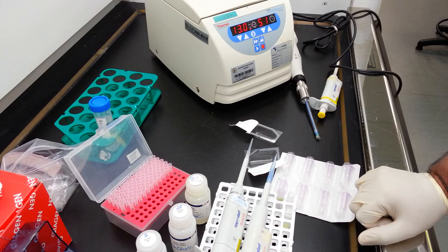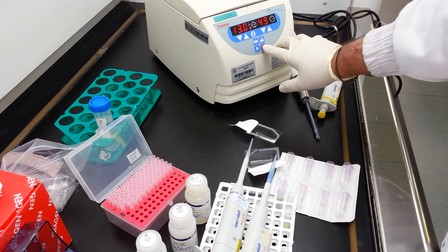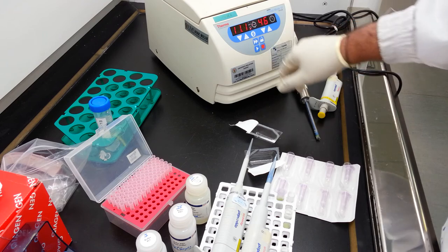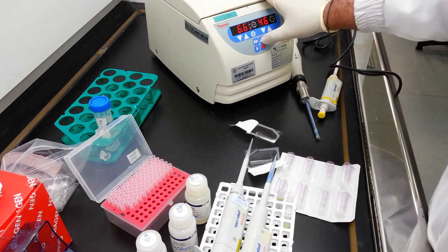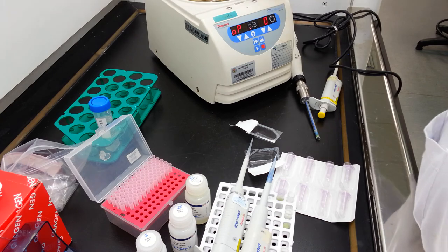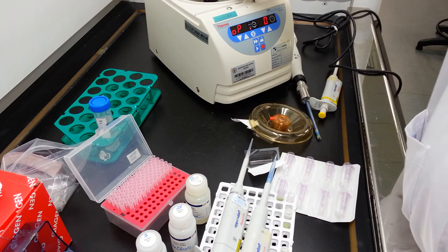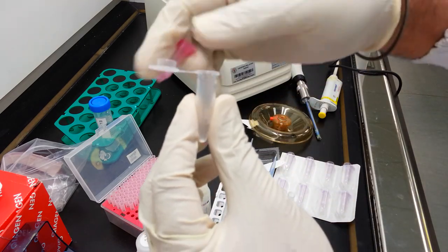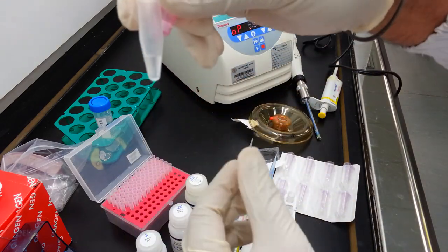For the purpose of this demonstration, I will abbreviate this spin. Your RNA can now be recovered in this collection tube.